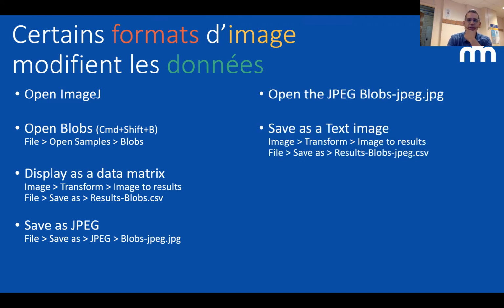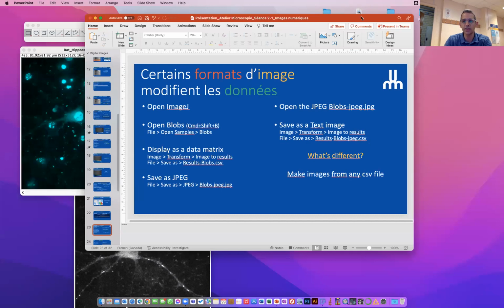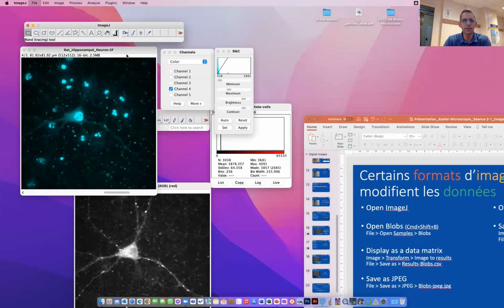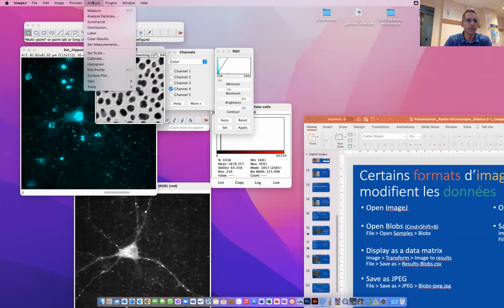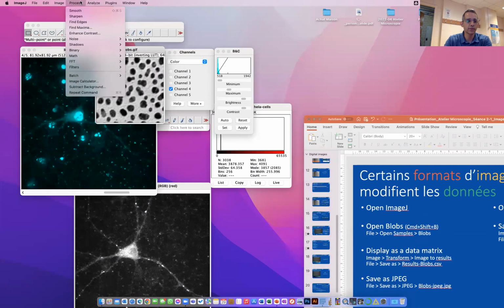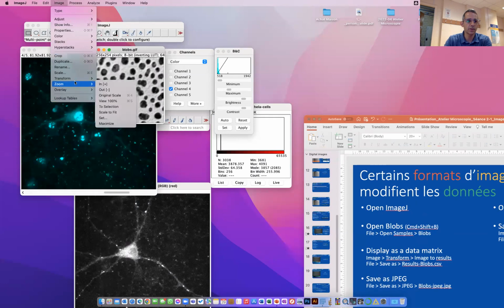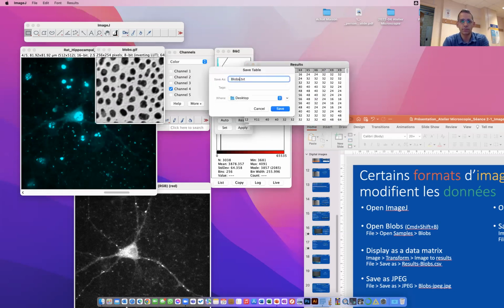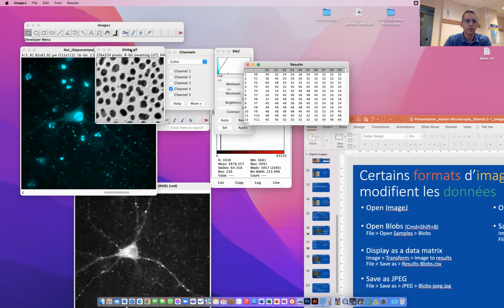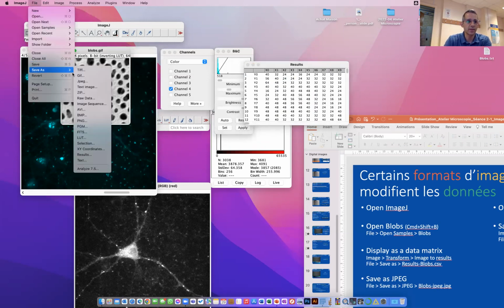So I don't think you have to do it. We can do it quickly together. It's going to be easier, and it's going to give us more time for the next part, which is, in my view, more relevant for you guys. So the exercise was to open blobs like that, transform it, image, transform into results, and save these results as blobs on my desktop. Now I'm going to take this image and save it as a JPEG image.